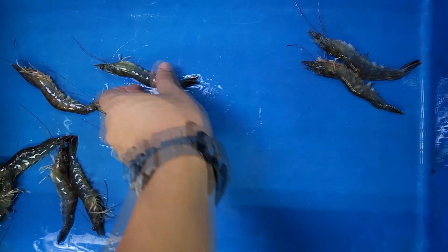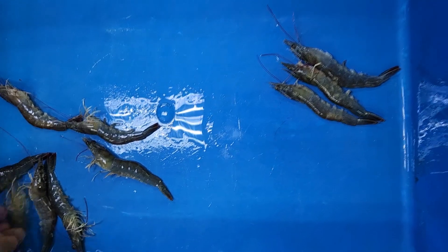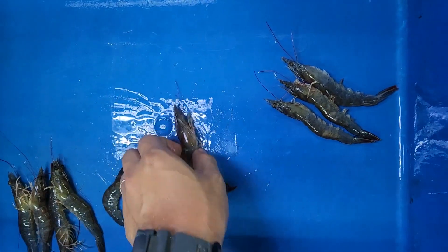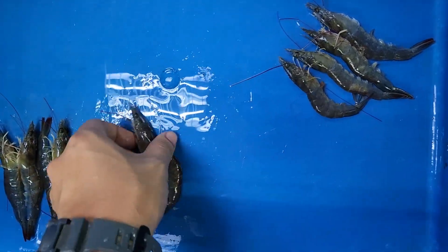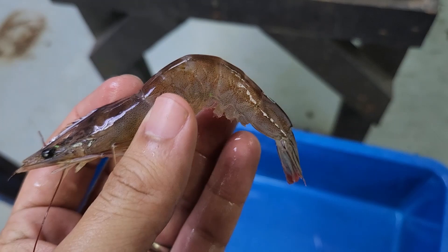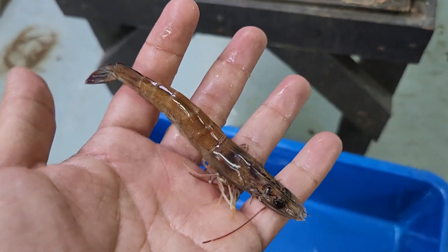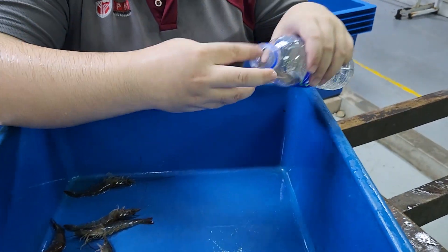The first step is to separate out the shrimps. I'll be separating them into two samples. The first will be on the left, which are still the live shrimps, and I'll also pick out the shrimps that are a bit weaker and separate them out to the right. The first sample will be all of the live shrimps, and the sample on the right will be those that are not so healthy or weaker in general. You can see the shrimps that generally look okay — you can't detect any lesions on them, so it's probably wise at this point to send them for proper testing.